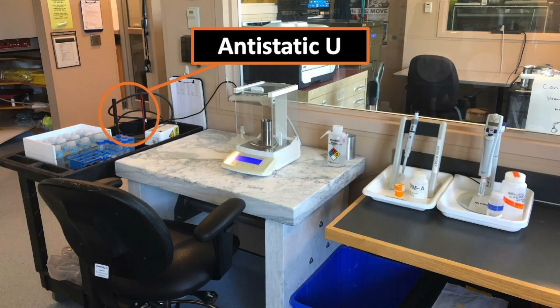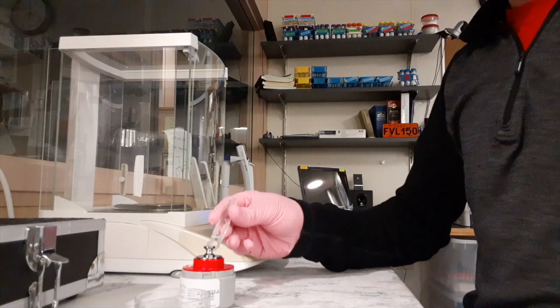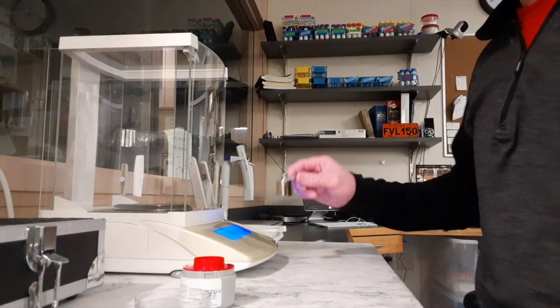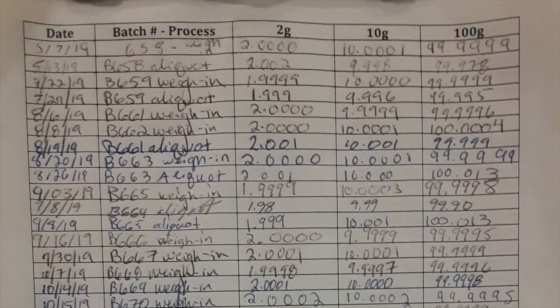We have an anti-static device. It's a U-shaped device that has an ion field around it that helps reduce the static on the Teflon bottles and on the quartz so that we can make an accurate measurement of the weight. We have a balance check weight record, and that means every time we sit down to weigh samples, we use a series of calibrated weights that we know the mass of to make sure that our balance is performing properly, and we write down those values every time we sit down to mass in a batch of samples.